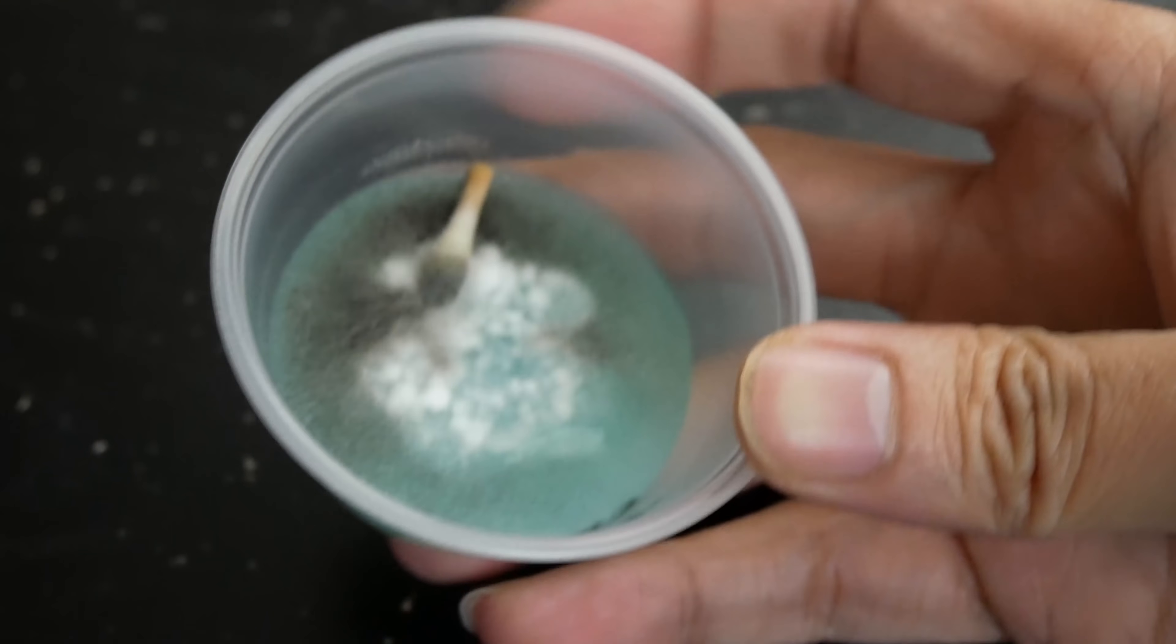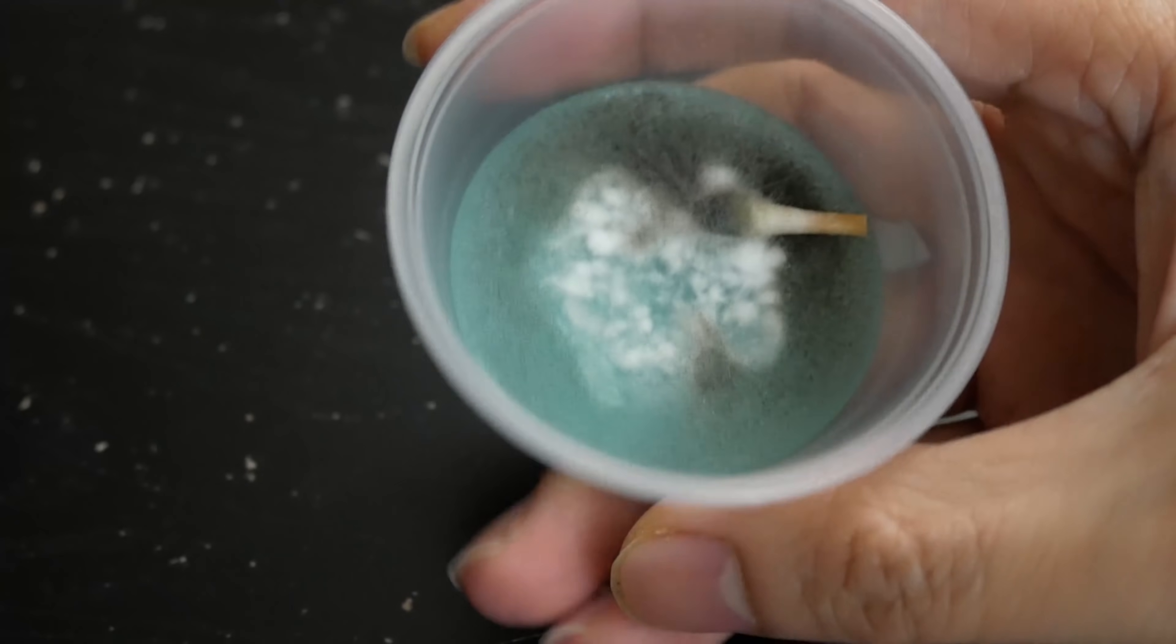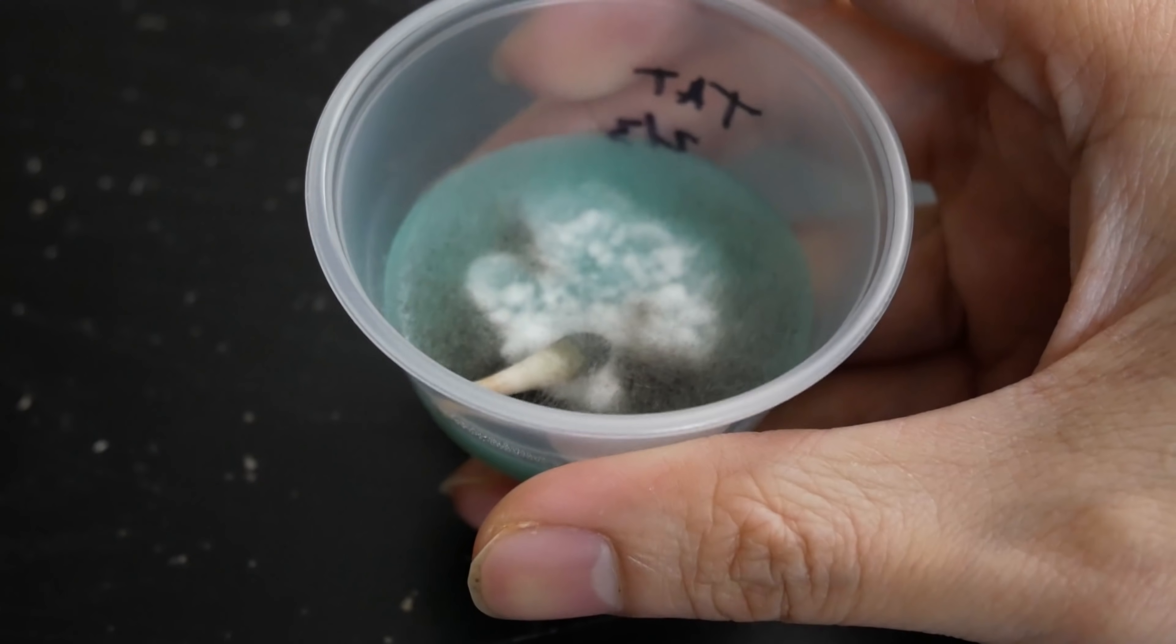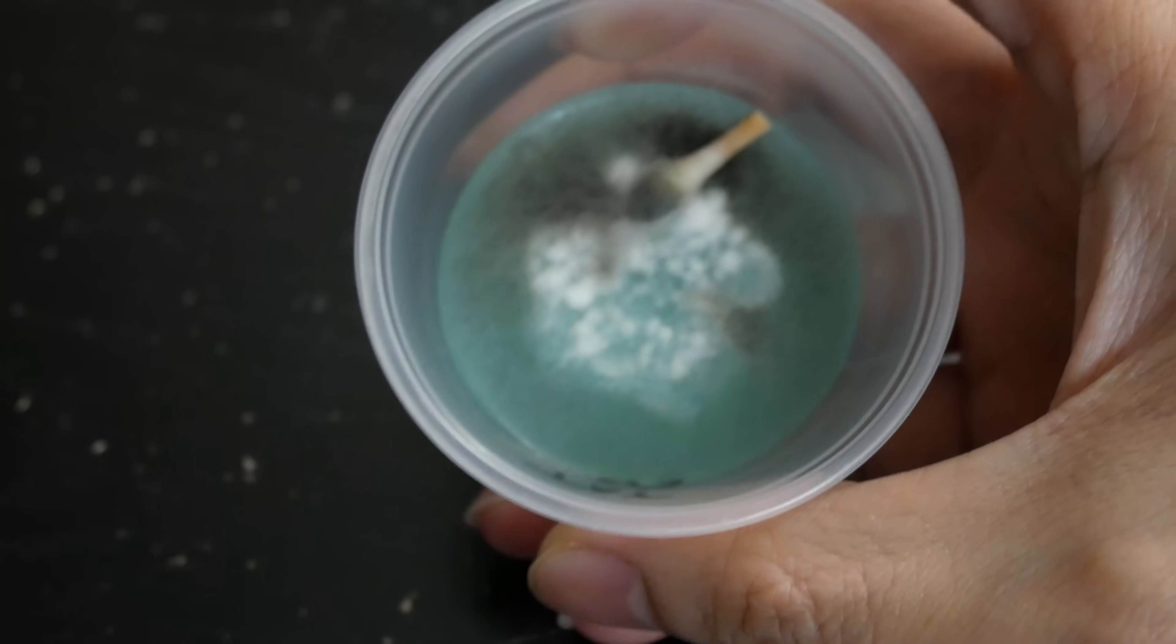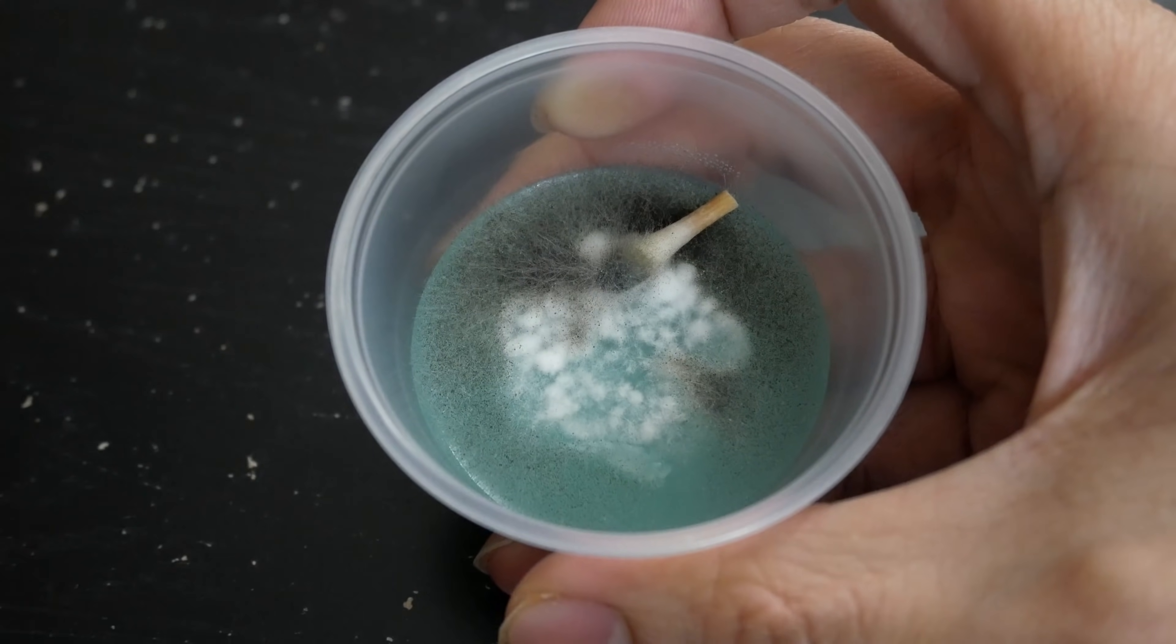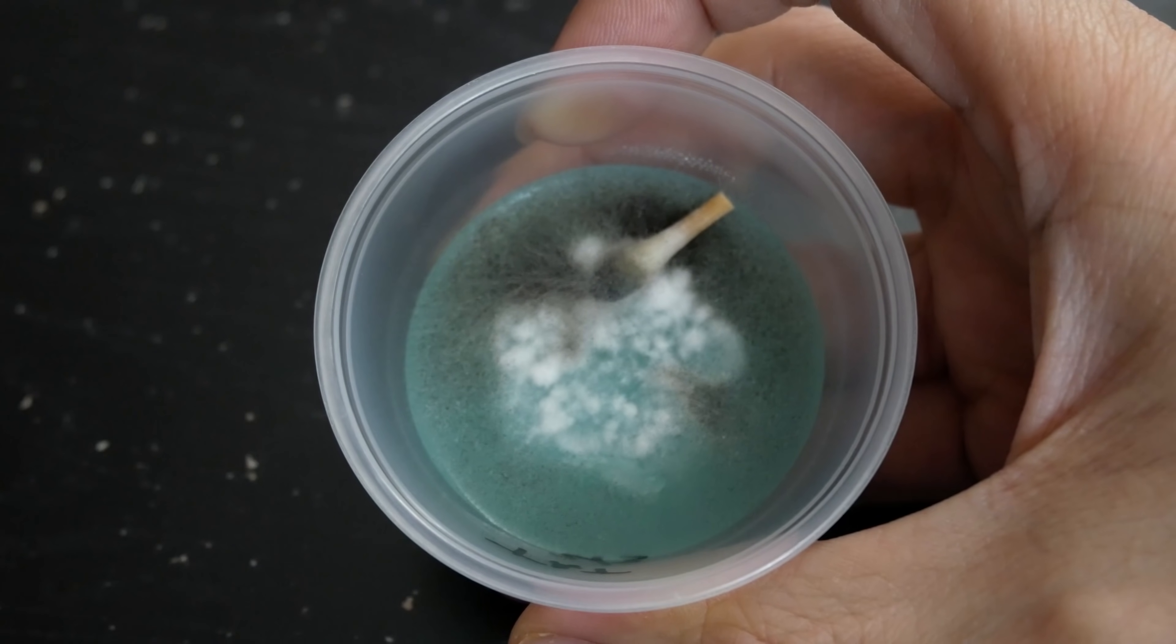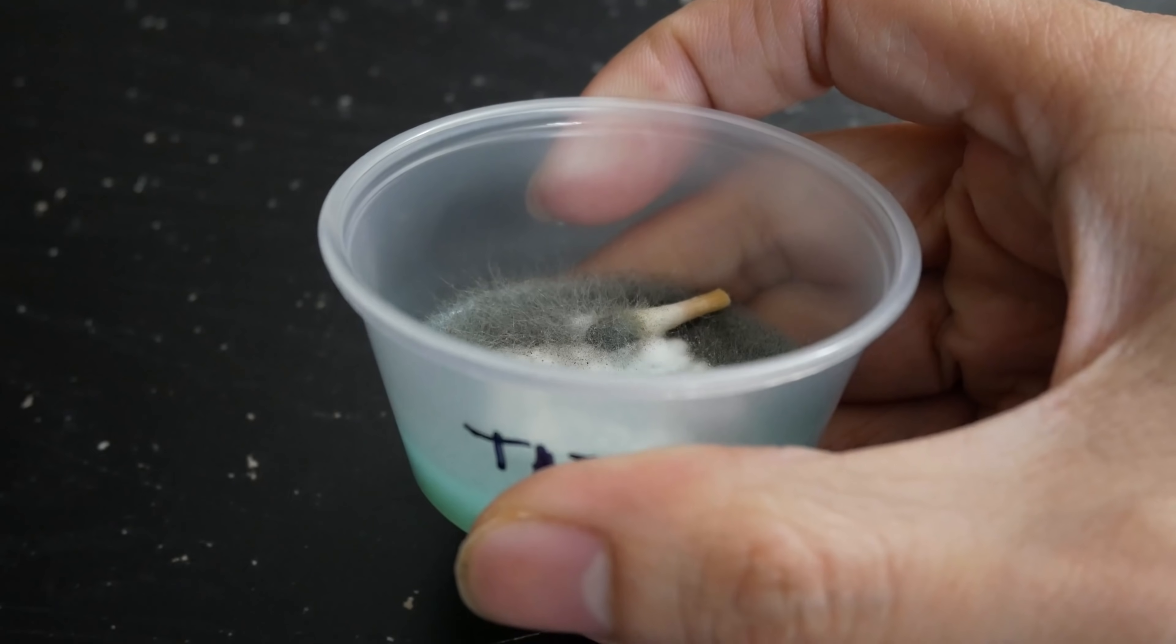Now most times when you get contamination, you don't want to really open them up. You really just want to throw them away because as you're opening them up, you're risking the spread of the mold spores from getting into the air and getting into the space surrounding you. I have a pretty clean surface table here that I'm going to clean up afterwards, so I'm pretty much doing this just for the camera, just to be able to give you guys a good view of these. I'm pretty much sacrificing my table here for your entertainment. So if you decide to do the same thing I'm doing, you're doing it at your own risk.